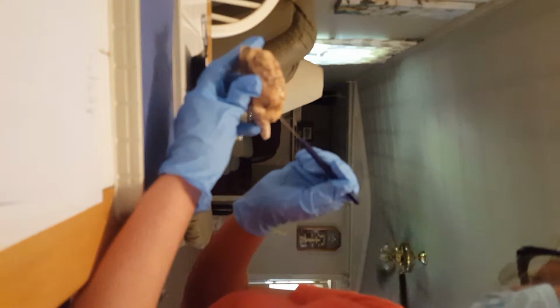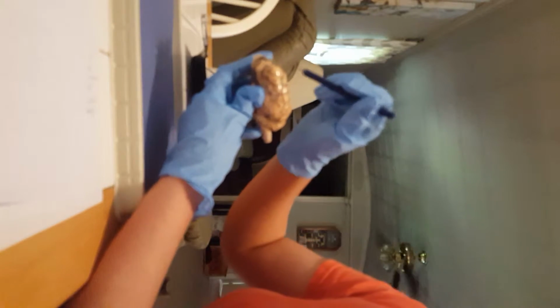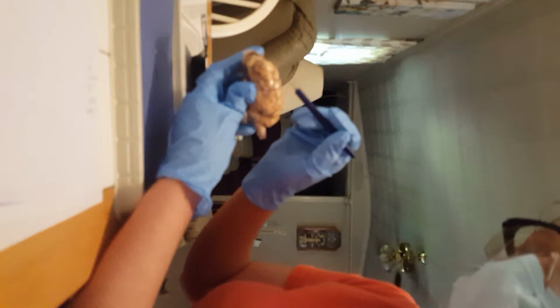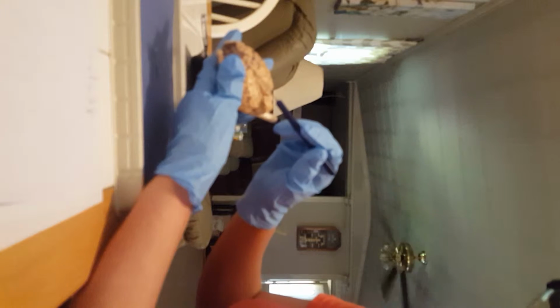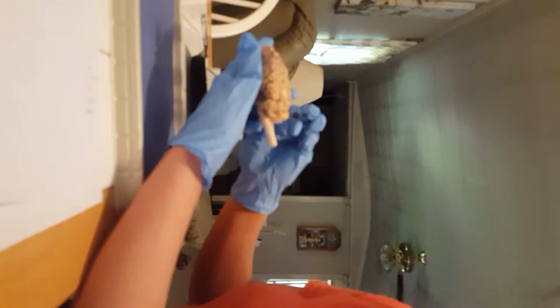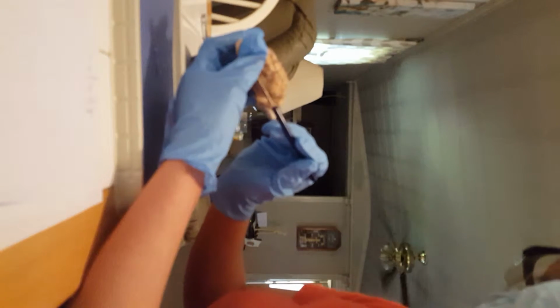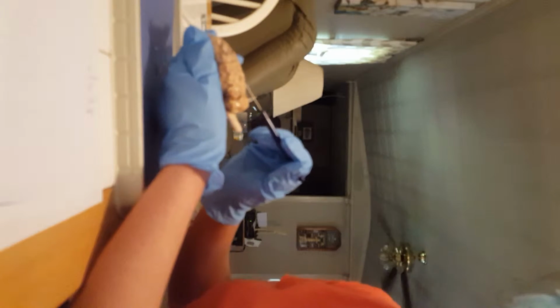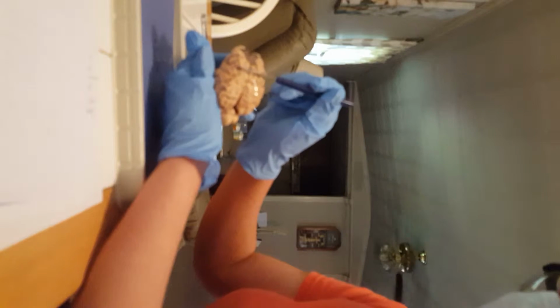From the lateral view, which is the side, I'm going to locate the frontal lobe, which is, of course, the very front of the brain, right up here. Then I'm going to do the parietal lobe, which is at the top. The occipital lobe, which is right here in the back. Then there is the temporal lobe, which is right here on the side. The central sulcus, I think that's somewhere up here at the top of the brain.